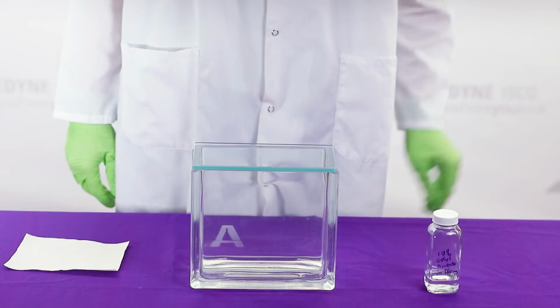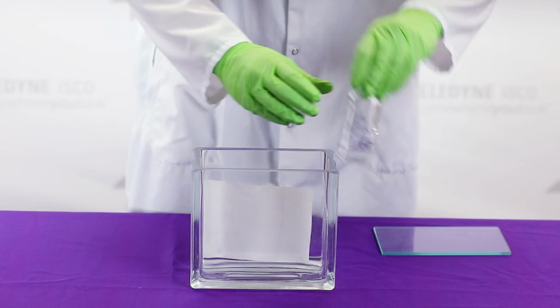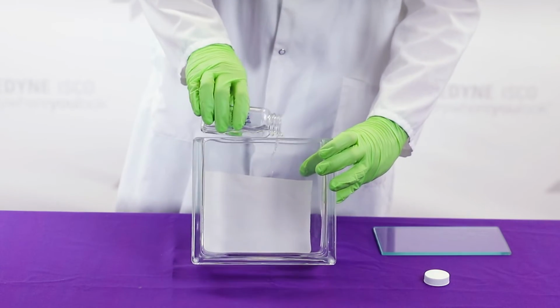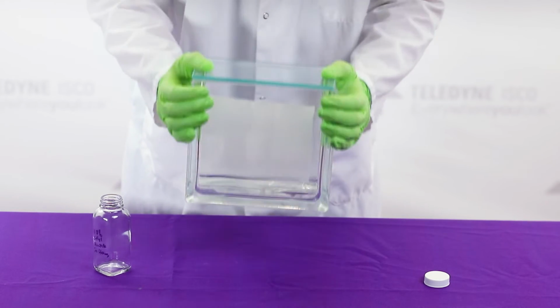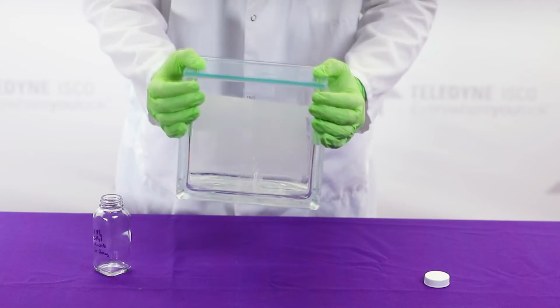Prepare your developing chamber by placing the paper inside. Tip the developing chamber back at an angle toward yourself and pour the solvent over the paper. Then, immediately place the lid on top of the developing chamber. To facilitate saturation, lift the developing chamber while securing the lid on top. Shake the developing chamber up and down until the paper is completely wet.